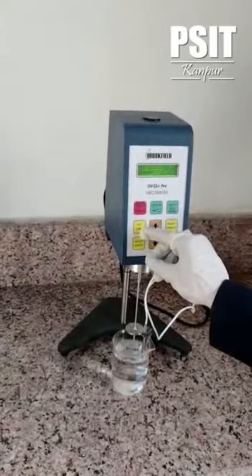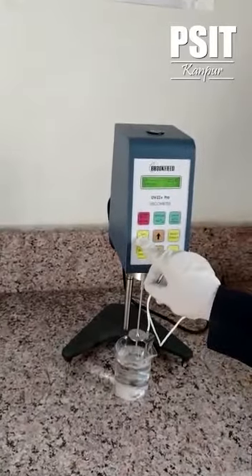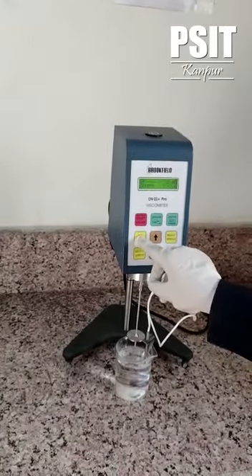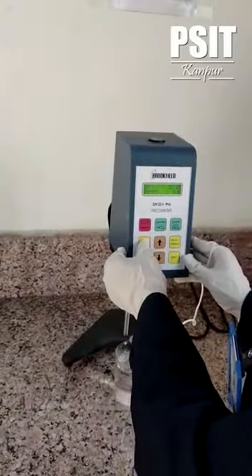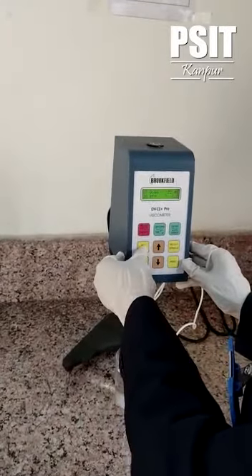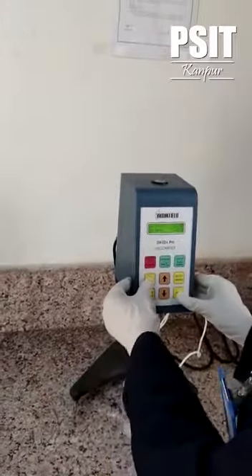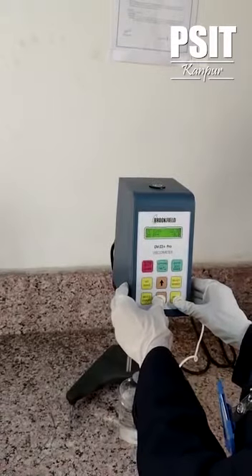Now in order to select the speed, we can have readings of viscosity at different speeds. You have to push the button set speed here. Once you will be getting the readings of set speed, turn on the motor. You can set the speed by using the up and down arrow.